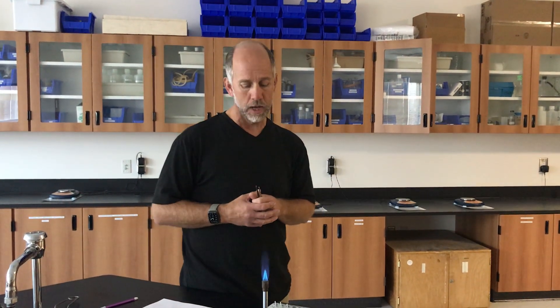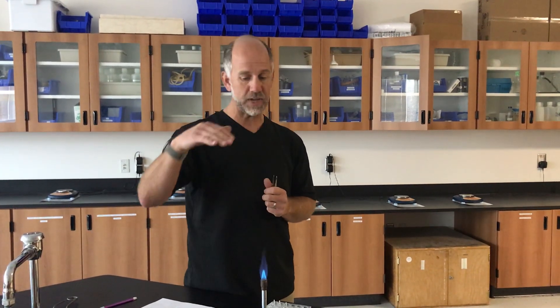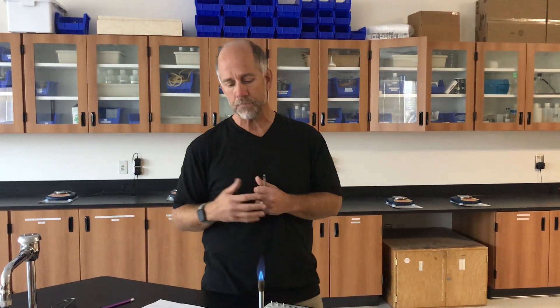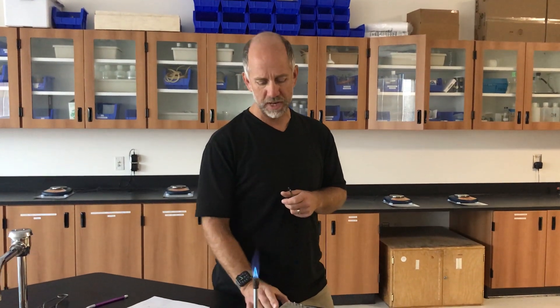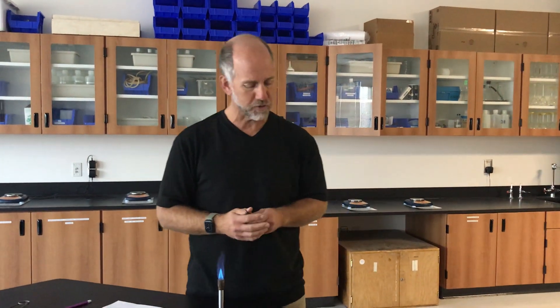To give you a general sense of what we'll be doing in this lab today, we're actually going to be flame testing some metal ions. As you know from the introduction, as we introduce energy in the form of heat into these atoms, it takes their electrons and excites them from a ground state to an excited state. And then when they fall back down to their ground states, they re-radiate that energy in the form of light.